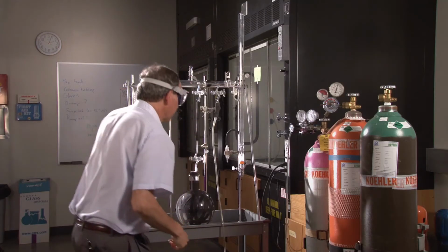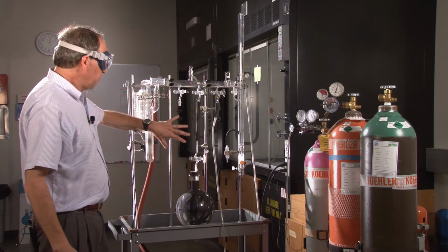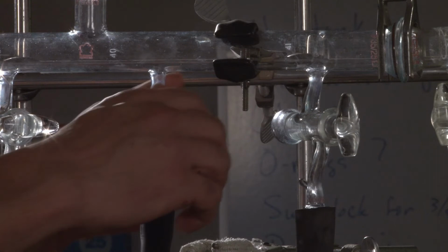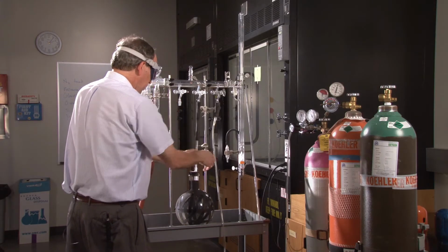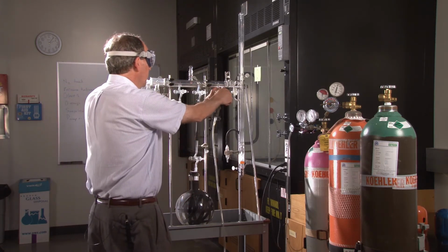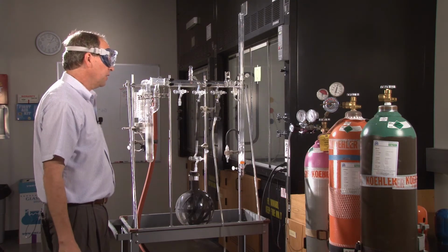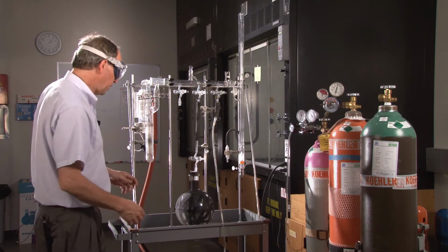Okay. So now everything is at the same pressure, but it's filled with pure CO2, including this, which is the container that we're really interested in. Now what we're doing is sealing the sample vessel. We're shutting off the manifold, and we're also shutting off the vent on the port onto the CO2 tank. And now I'm going to remove the sample vessel from the manifold.